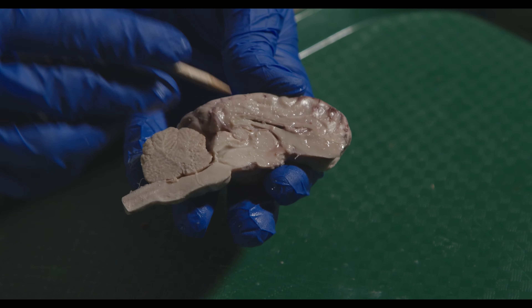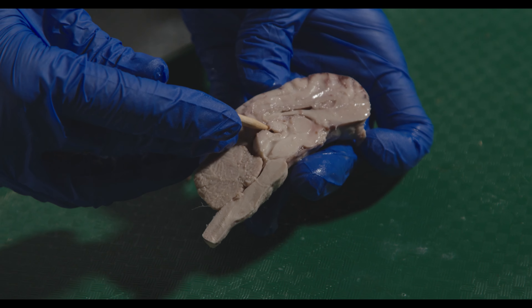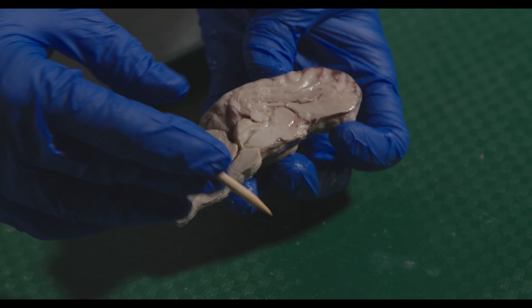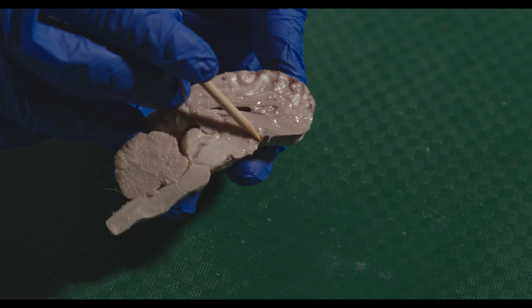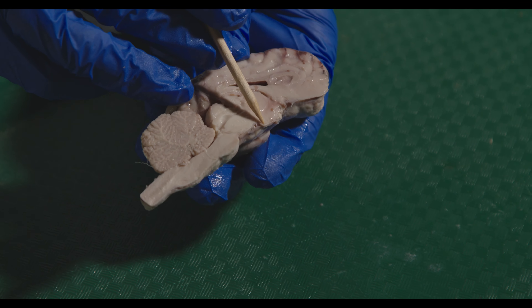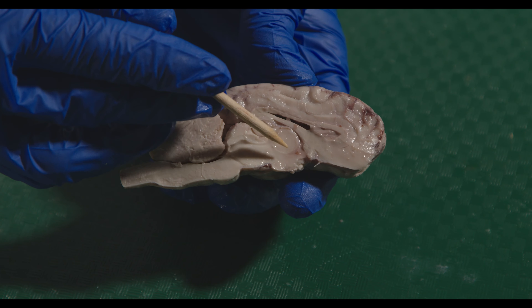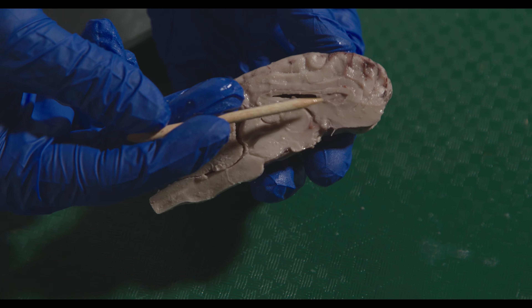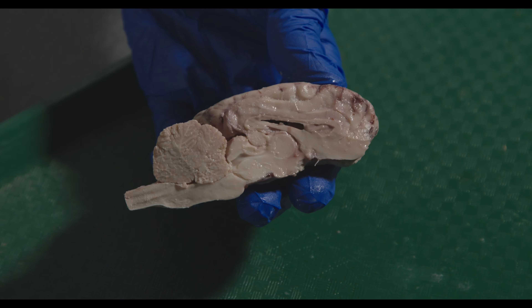We can also see the pineal gland — we cut right through it on this specimen. Then we have the superior and inferior colliculi, seen from the midline now. The optic chiasm is hard to see on this specimen since it was damaged when removed. The mammillary bodies are right here — really important for learning and memory. They send projections through the mammillothalamic tract up to the anterior nucleus of the thalamus. This large structure here is the thalamus, and the third ventricle runs between the two thalami — so our cut went right through it, separating the two thalami.